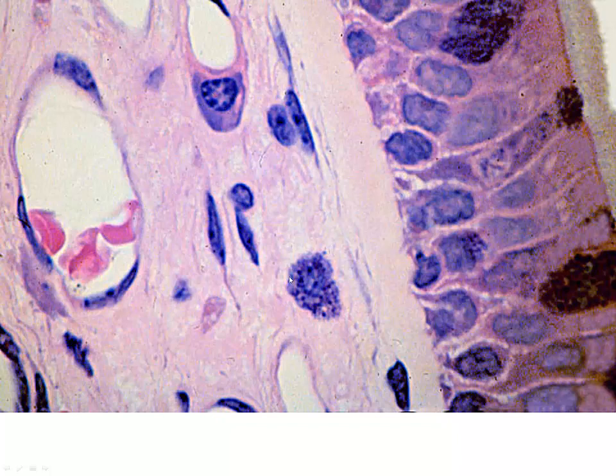And here we have a really, really dark cell, large granules, and the granules practically obscure the nucleus, these dark blue staining granules. If it was in our circulation, we'd refer to this as a basophil, but out in our tissues, that's our mast cell or tissue basophil.